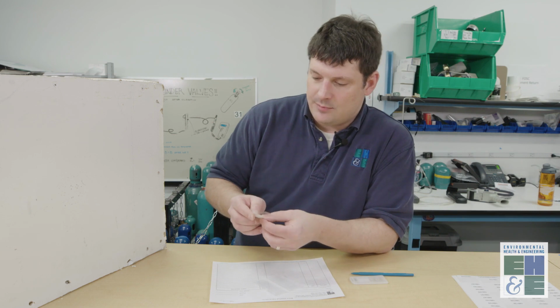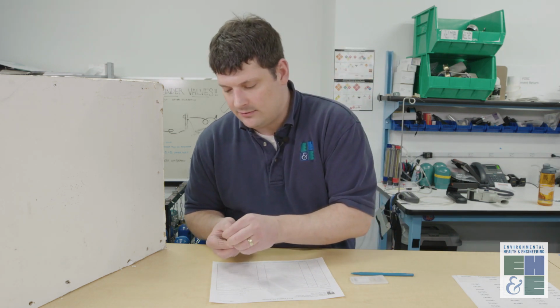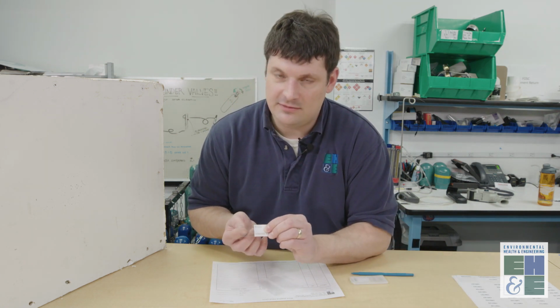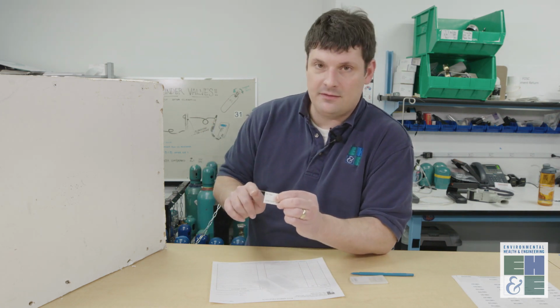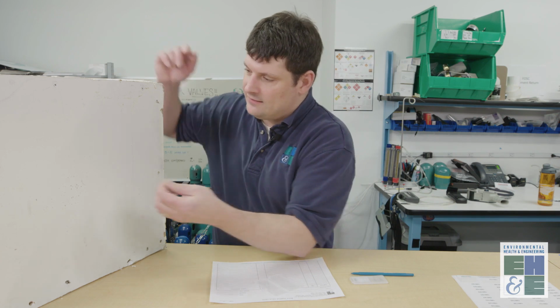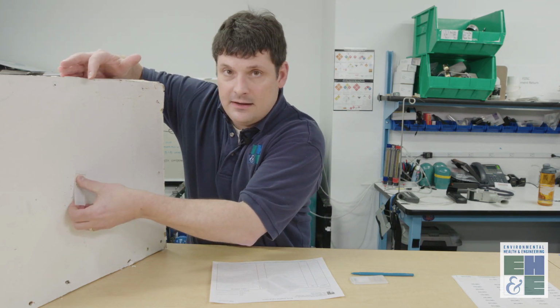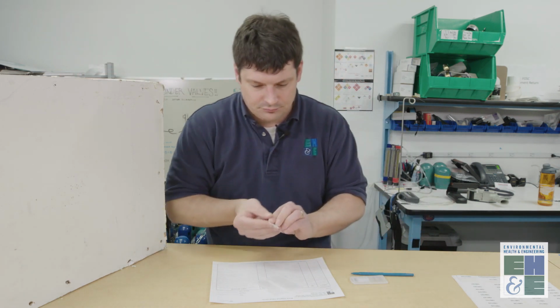To collect the sample from a surface, you peel and discard a small plastic covering right here. This just goes in the trash. And now you're left with a sticky surface on the tape. So you apply this sticky surface to the surface that you're going to test, for example, a wall like that, and you press down lightly and remove it, and the sample is collected.